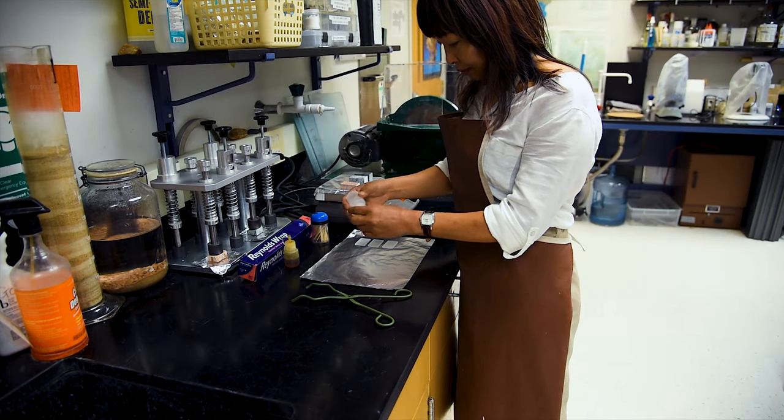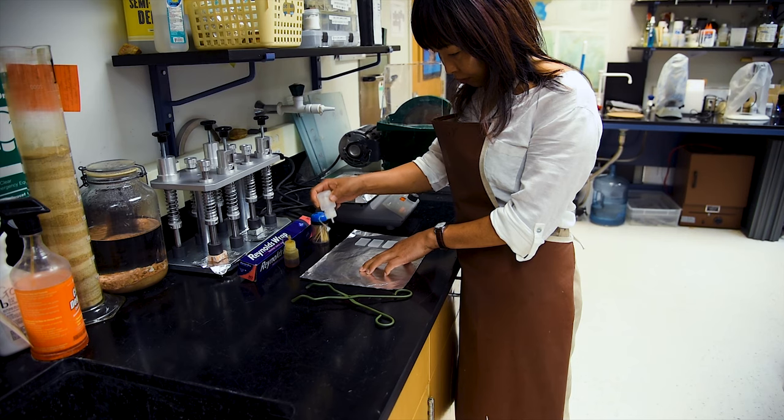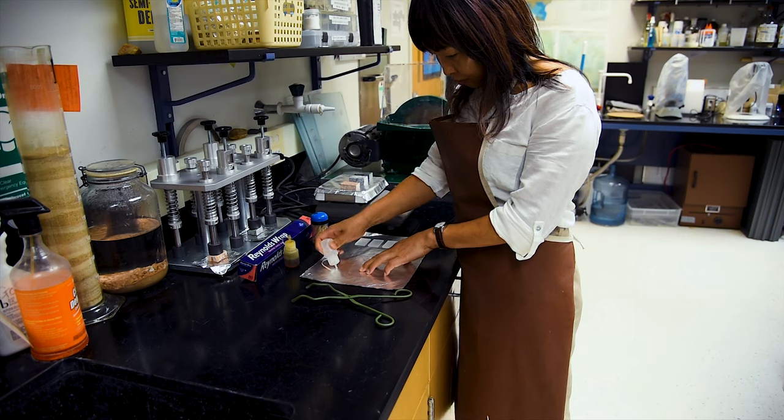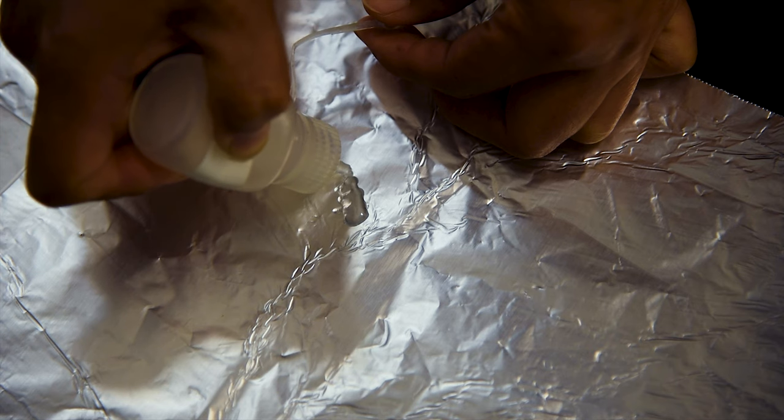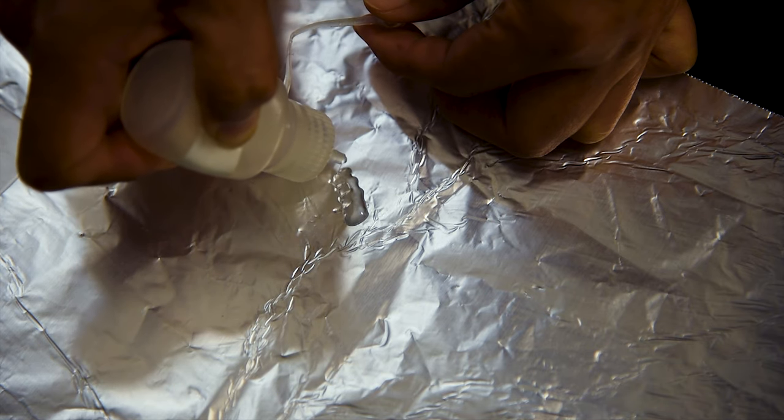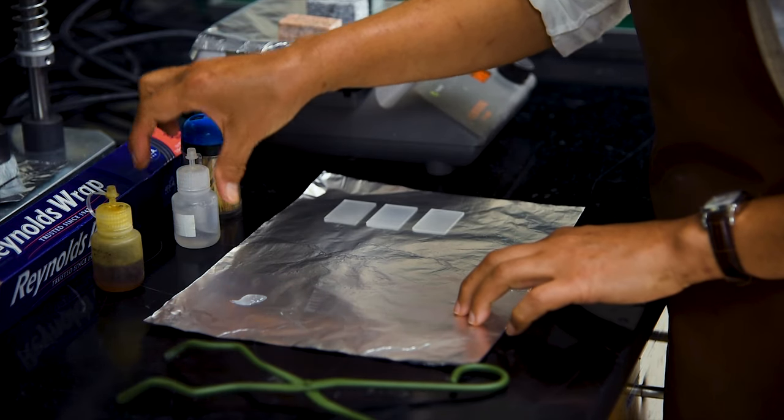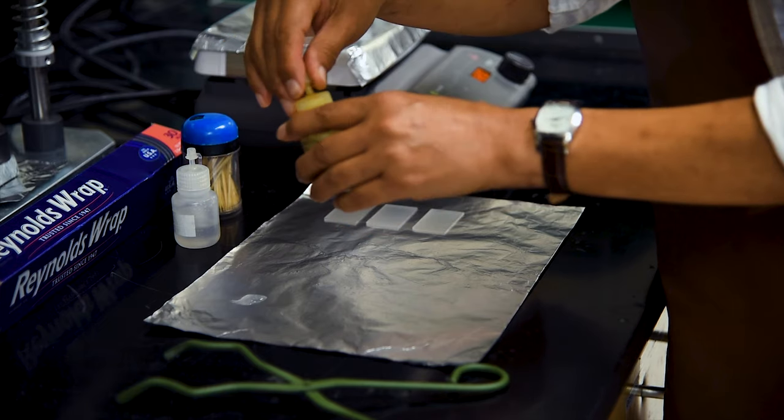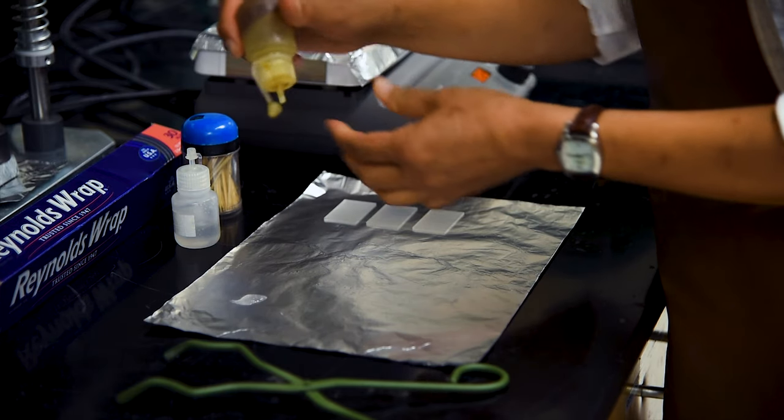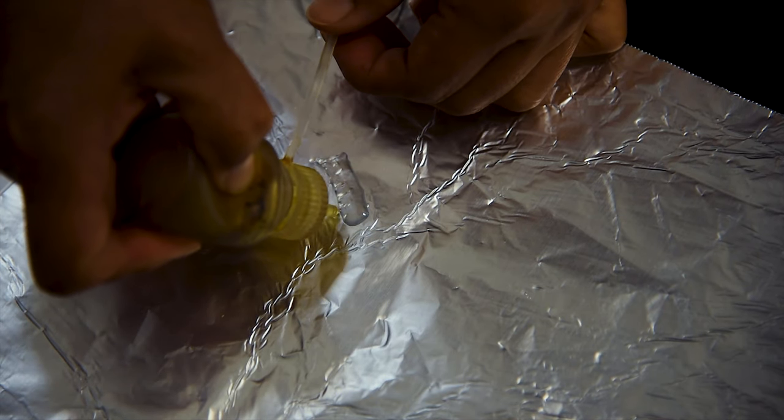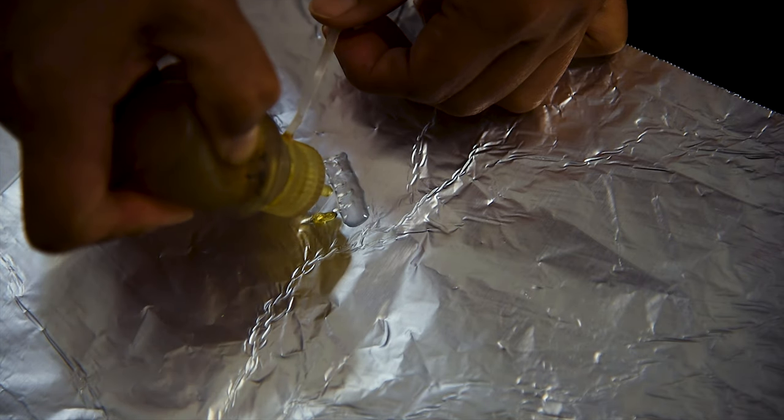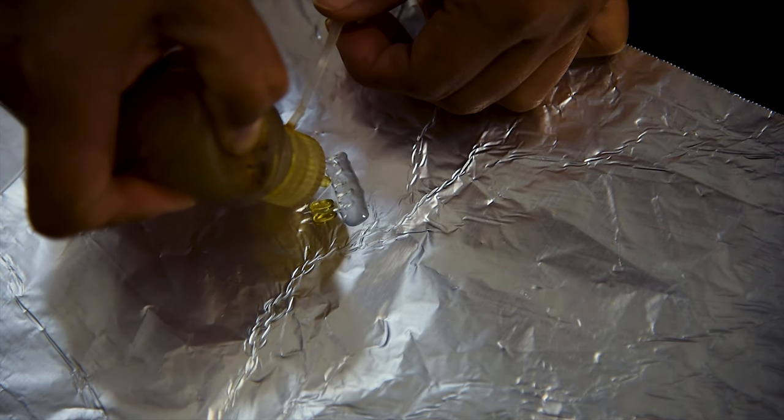We use a sheet of aluminum foil as a base to prepare the epoxy, spread it onto the hot, polished surface of the sample chips, and apply the frosted glass slides. The epoxy that we use is mixed together in a 7 to 3 ratio. Using small plastic bottles filled with part A and B, we approximate this ratio by squeezing out 7 drops of part A and 3 drops of part B that we will mix together.